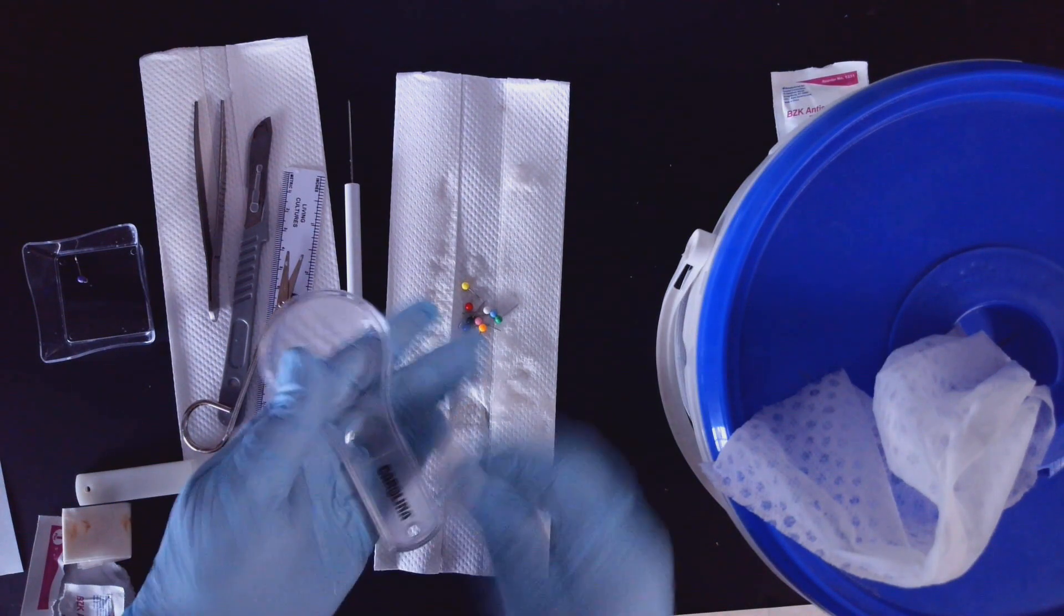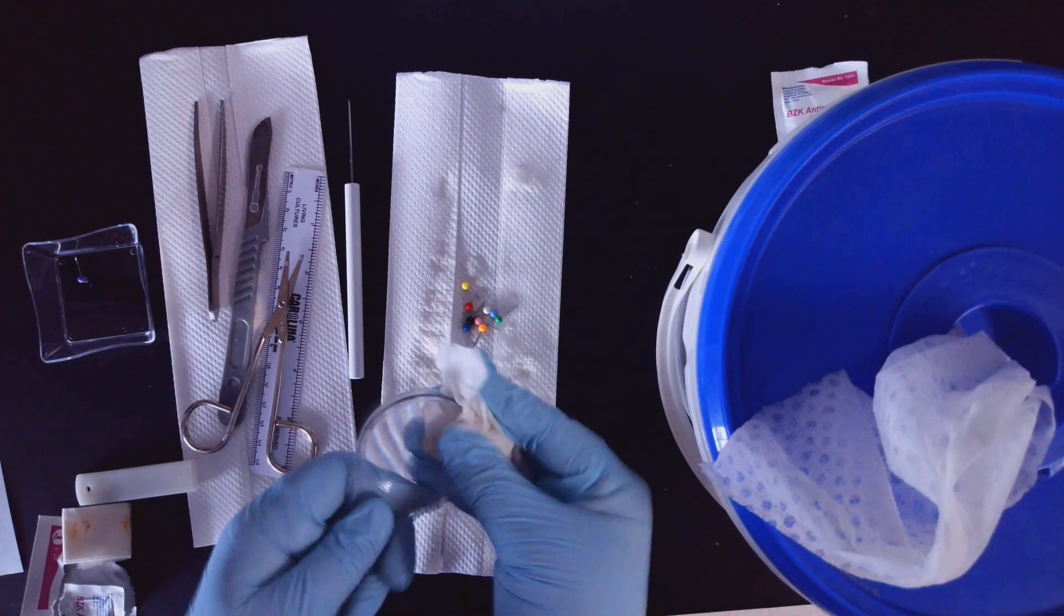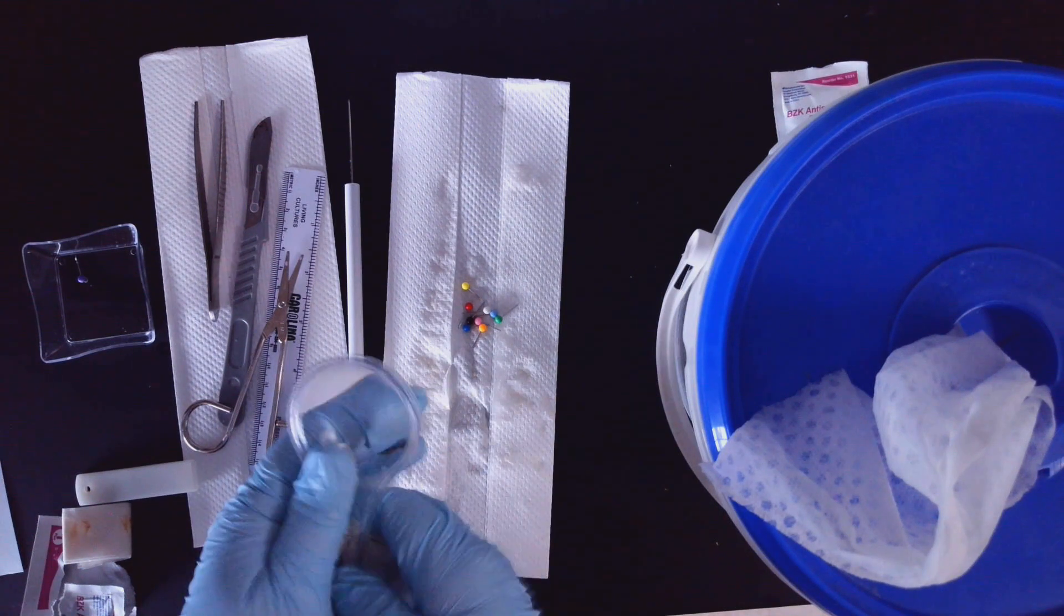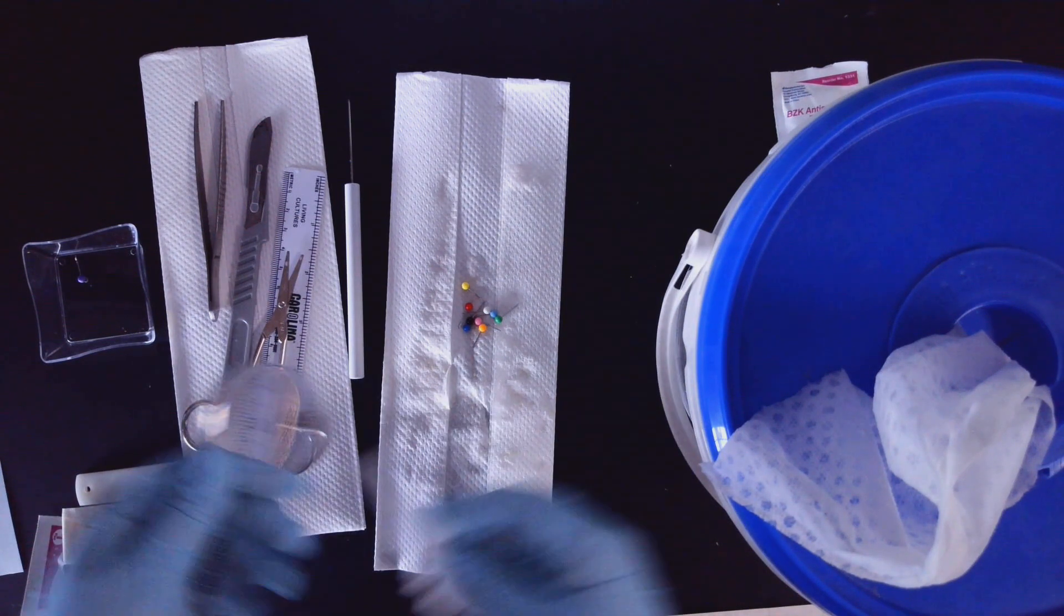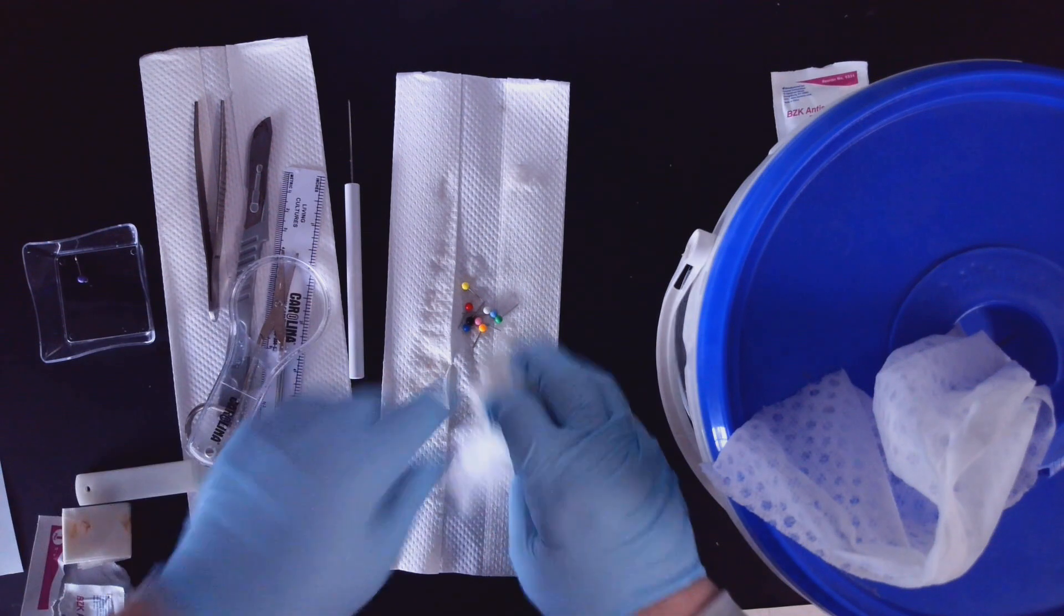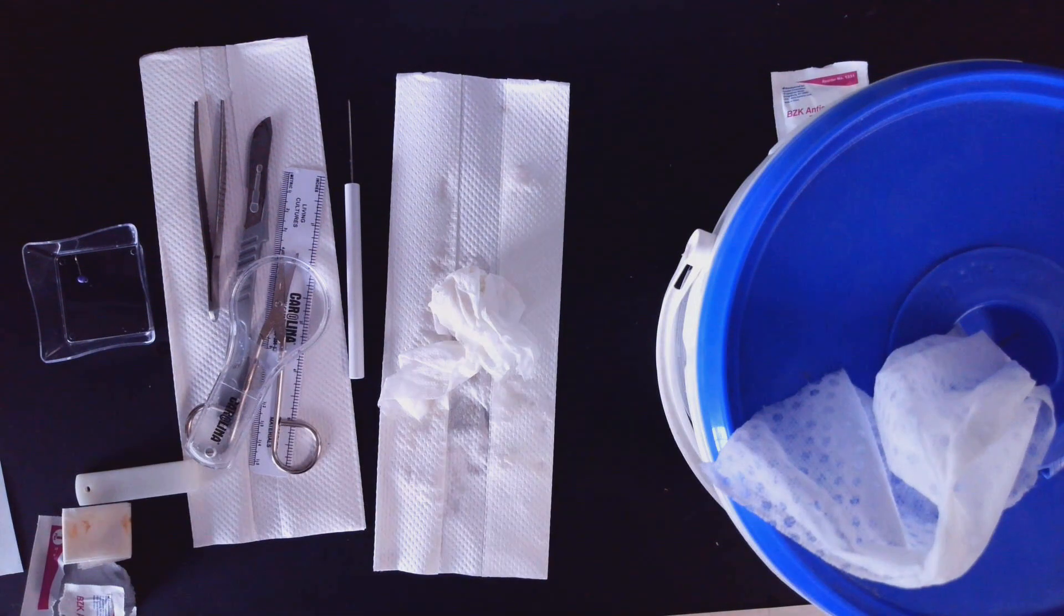Also, don't forget - here is the hand lens magnifying glass - don't forget to wipe that off as well. So get all of that cleaned off. We're going to finish cleaning those pins.